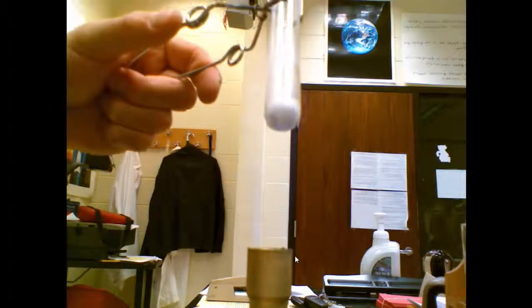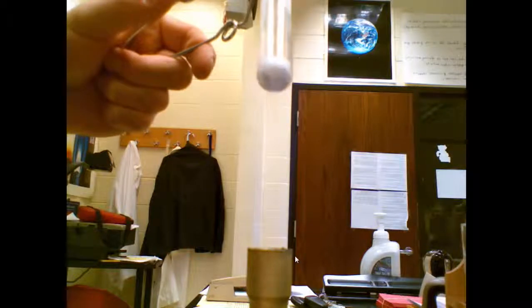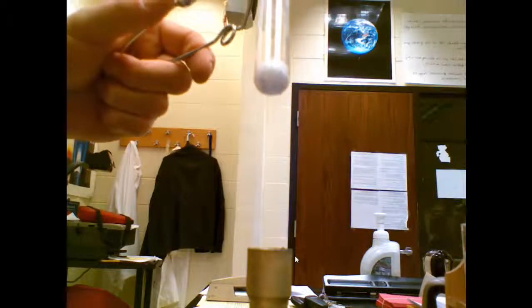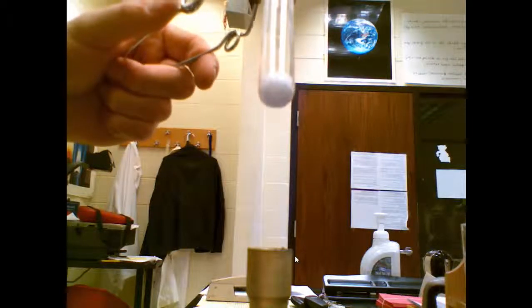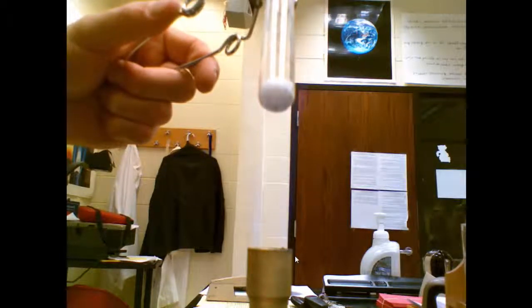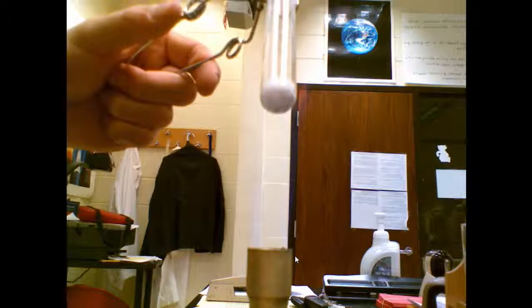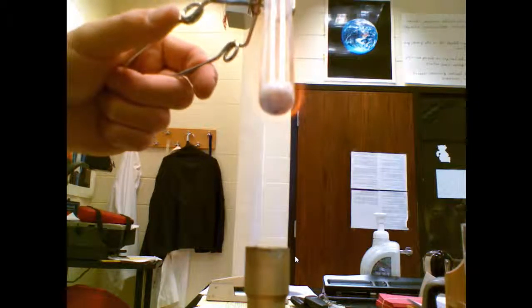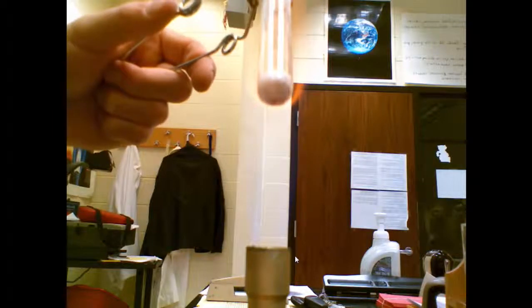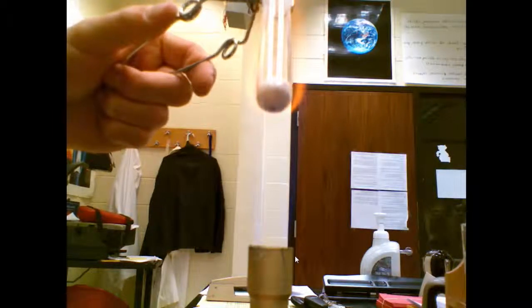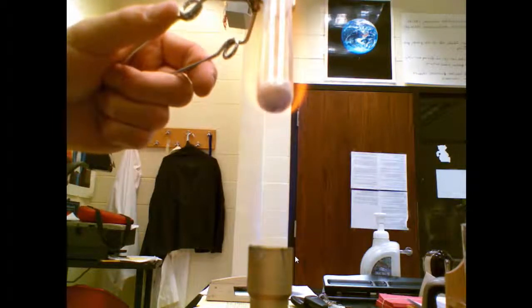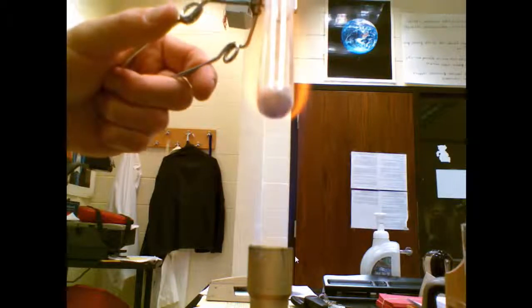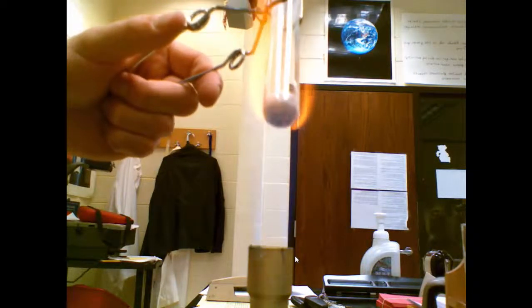Crystal number three, white granular solid. Past immediate melting. Okay, flame has turned yellow right now. Still no melting. Flame's yellow, no melting. So this did not melt in our Bunsen burner.